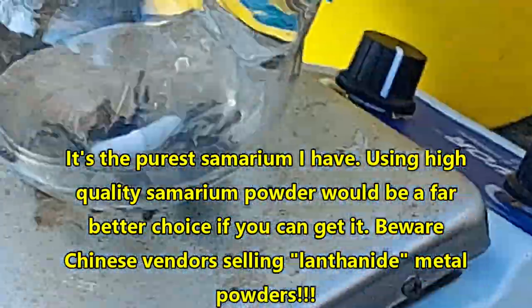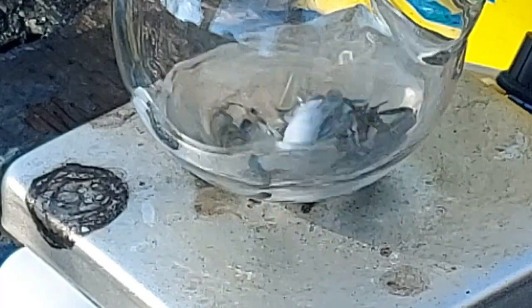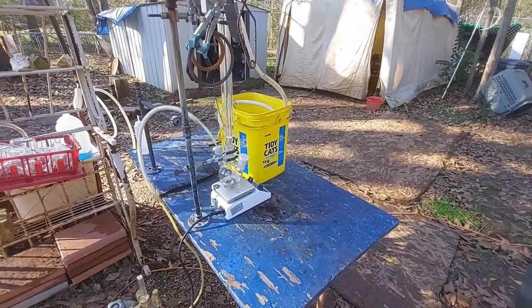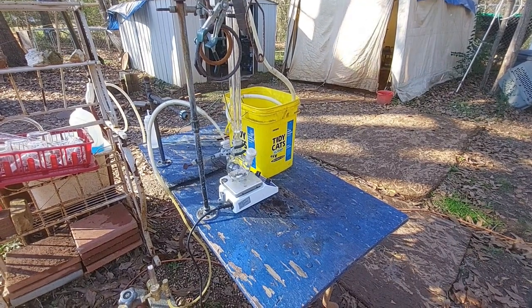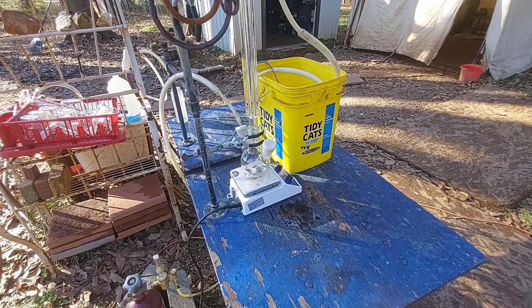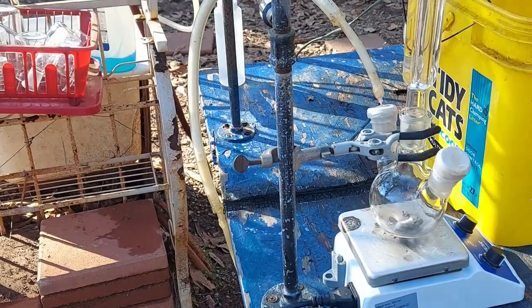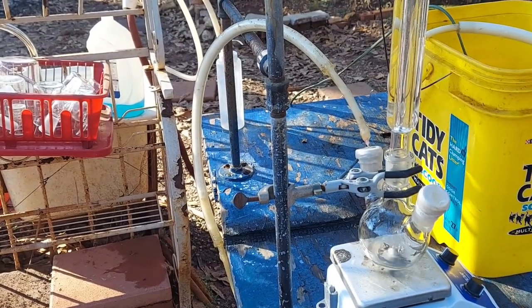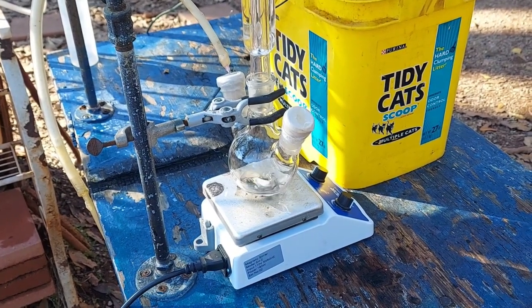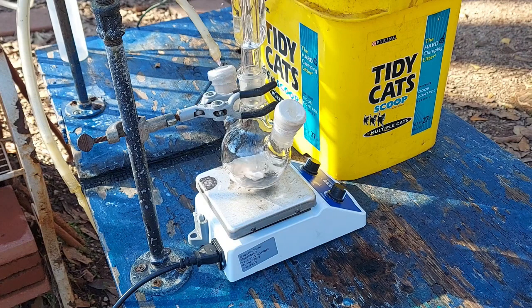That is what we have going on down here. The THF has been dried over molecular sieves and refluxed to degas it. I have done everything I can. This entire apparatus has been flushing with argon for over half an hour now, not counting the time I already flushed it before and then had to put everything on hold because the gas line broke. I've got my redneck powers at maximum here — the argon cylinder, a thick section of tube packed with calcium chloride pellets dried in the oven for hours, coming down through a hypodermic needle epoxied onto the end of the hose, feeding into the apparatus. I have flushed out both necks and I am really hoping I've managed to get all the air out of this thing.